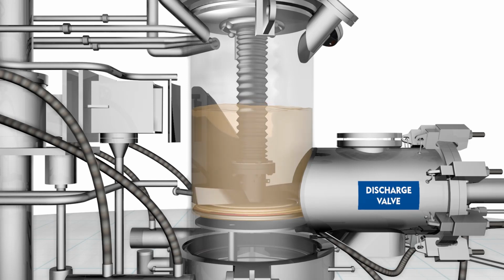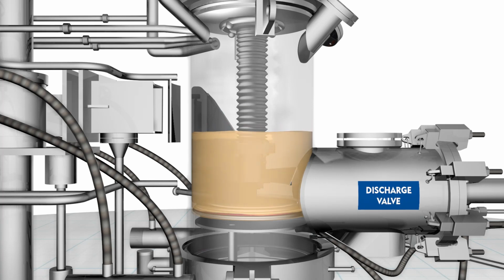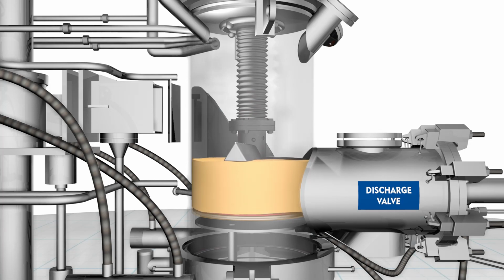The agitator is lowered till it activates the proximity switch PS2. The lowering action is stopped. The agitator is rotated in forward and reverse directions at preset intervals for a prescribed time for thorough wash of the cake with the wash liquid.